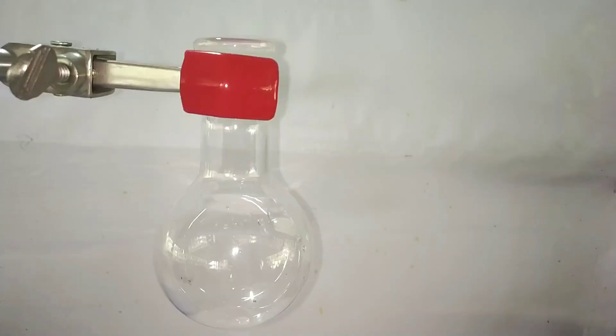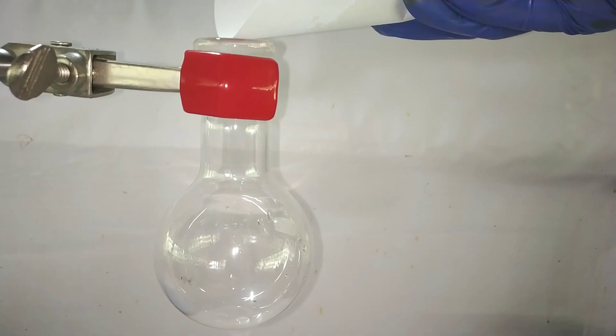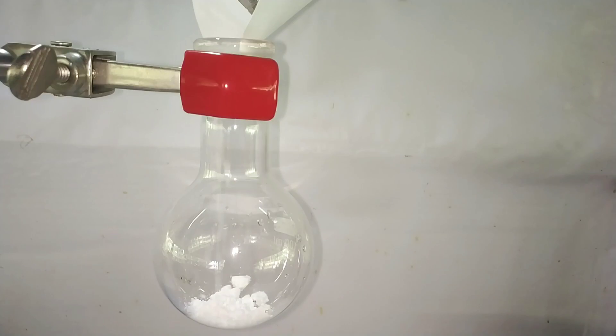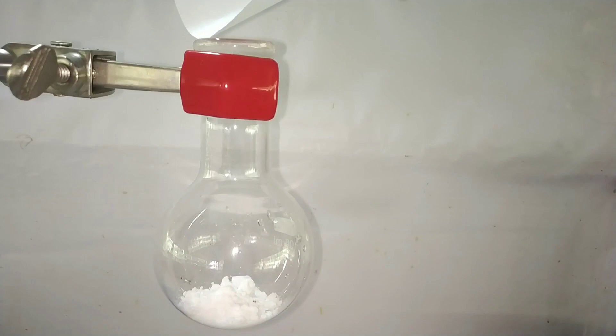Start by clamping a 100 milliliter round bottom flask onto a stand. Then we add the pre-weighed 3.55 grams of thiamine hydrochloride. Instead of directly using the pure chemical compound, you can of course try using vitamin B1 supplements. But since this video is also for academic purposes, I am using the pure salt.